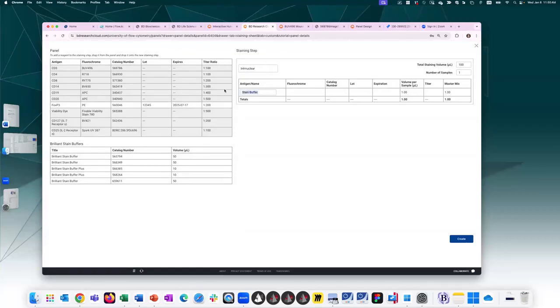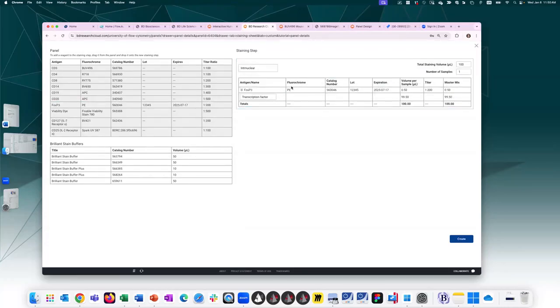And this is going to be the transcription factor buffer that I'm using. Transcription factor buffer instead of PBS or wash buffer. And I'm just going to drag in FOXP3. This one has PE. And so again, I can update the number of samples and staining volume as needed. So if I have FMOs, I can always change these number of samples as well.